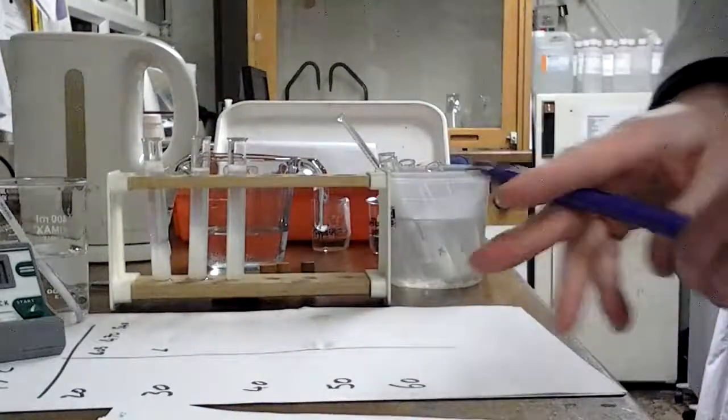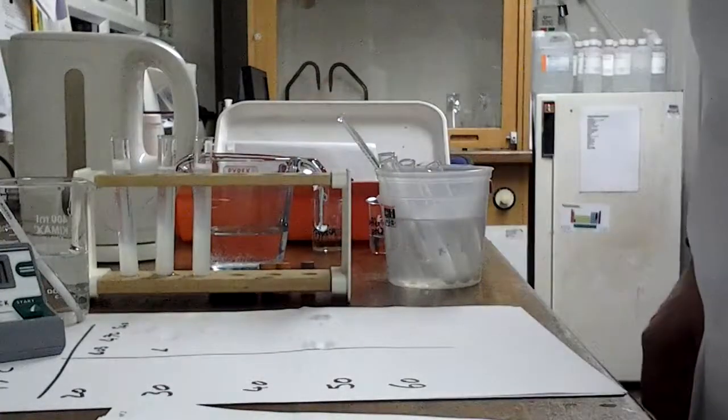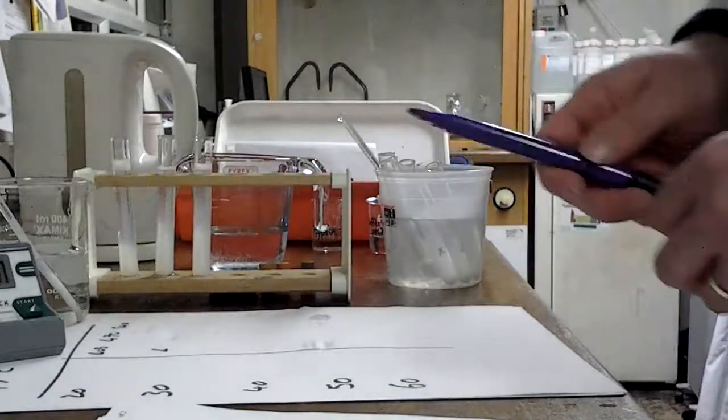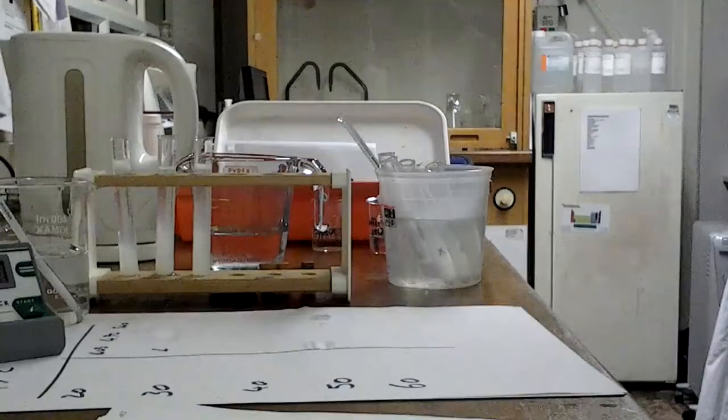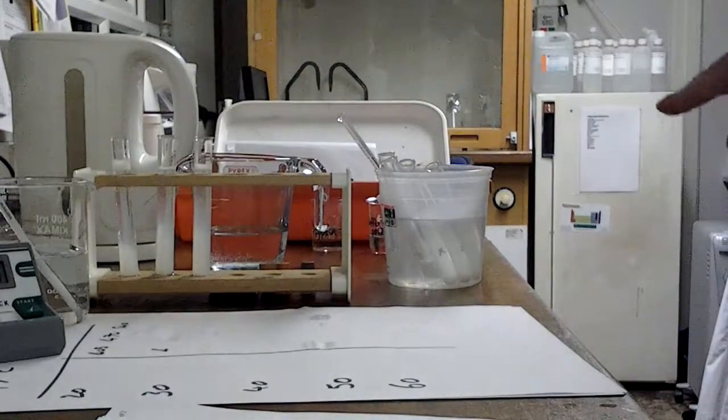Okay, so I've got my first set of results, 3 repeats for those test tubes at that temperature. That was 20 degrees. What I'm now going to do is I'm going to just pause the tape and do 30 and 40 degrees exactly the same way. Then I'll have a look at one that goes a little bit faster at 50 degrees. But I'm sure by now you're getting the idea of how this experiment works.